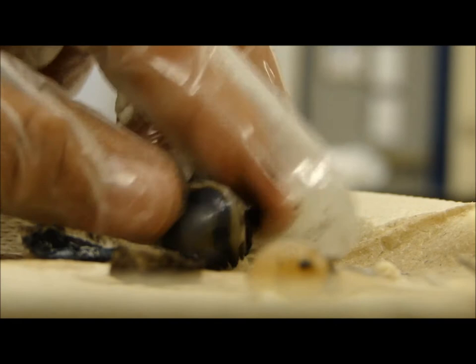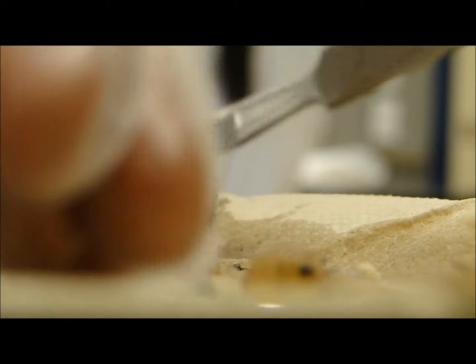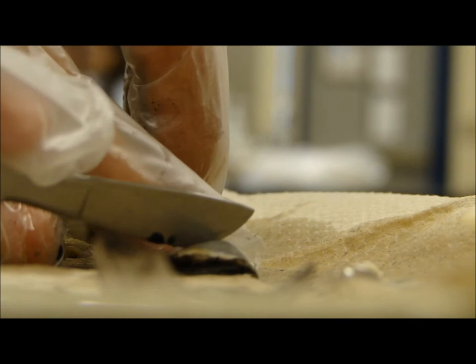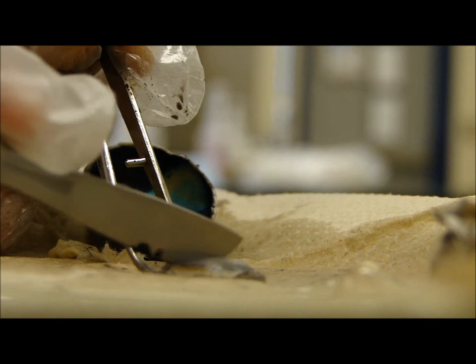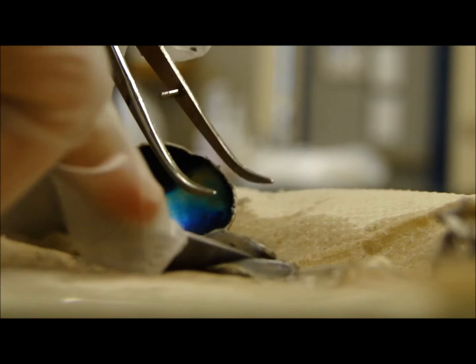There we go. Now we're gonna cut the cornea in half and observe its thickness, so use the scalpel and cut it in half. This thing? Cut the cornea in half, yeah. Which way? It doesn't matter. Alright, so it's thick.